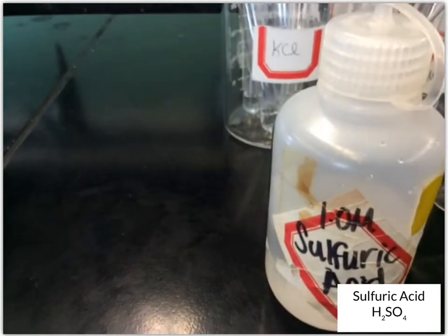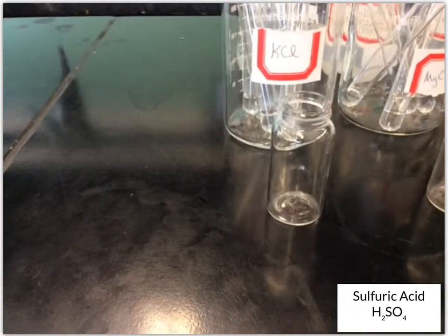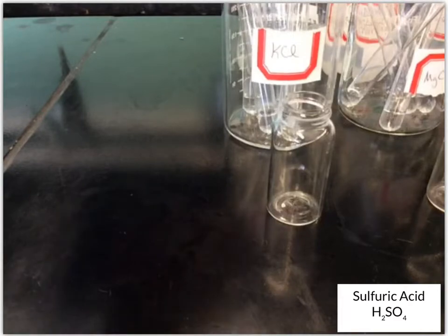If so, we need to write that down. Write down whether there is no change observed, or some precipitation, or bubbles. Whatever you see, jot it down to keep track, because we want to know what these known solutions do with each substance. That way, when we get to the unknowns, we can compare our results and figure out what the unknown solutions are.